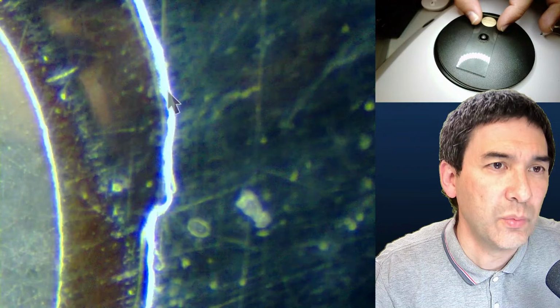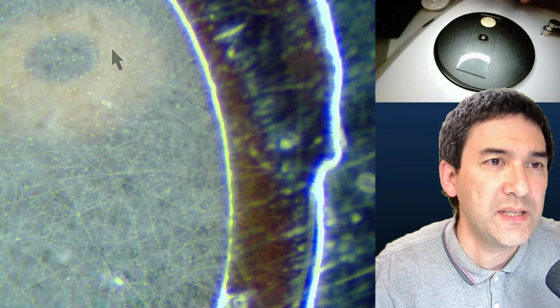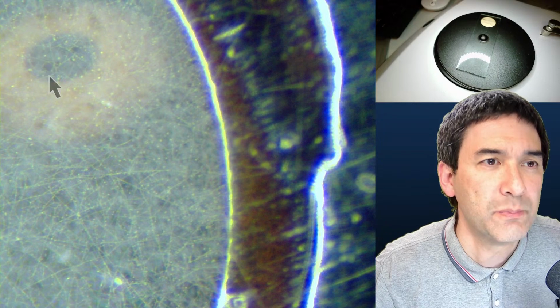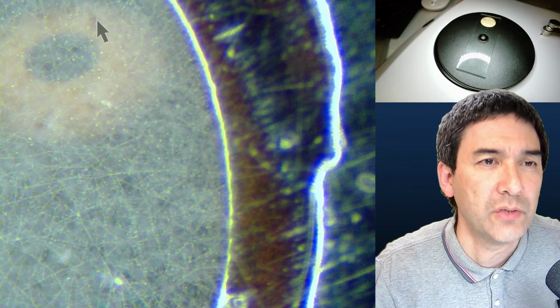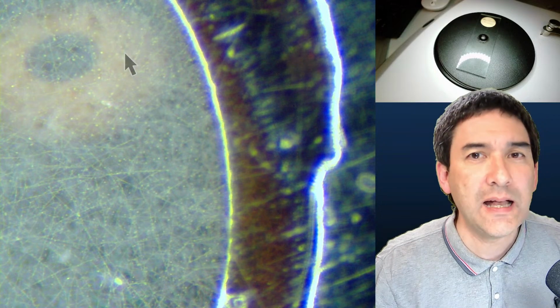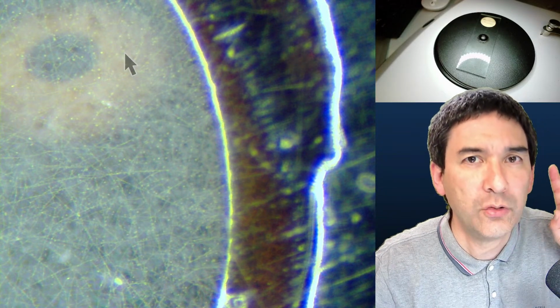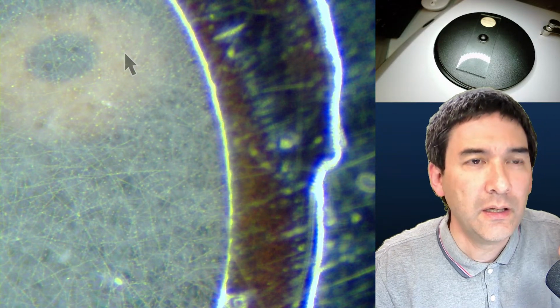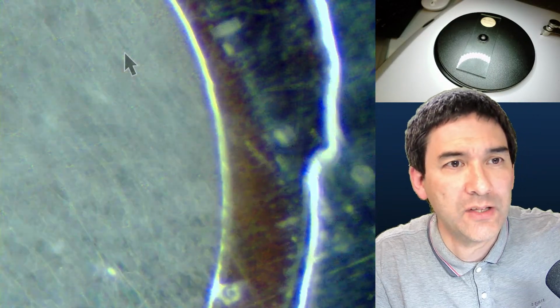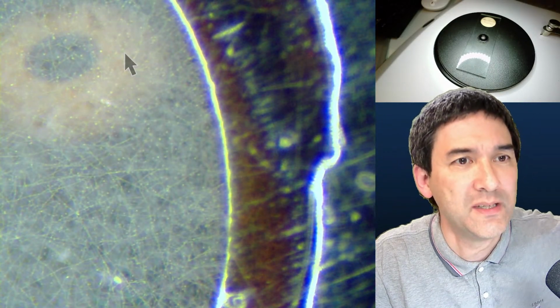And somewhere else. And do you actually see this ring here? You see there's a dark spot here and there's a brighter area around here. Okay. And this is actually a reflection of my room light going through the eyepieces. So what I'm doing right now is I'm holding my hands over the eyepieces and look what happens, it disappears.